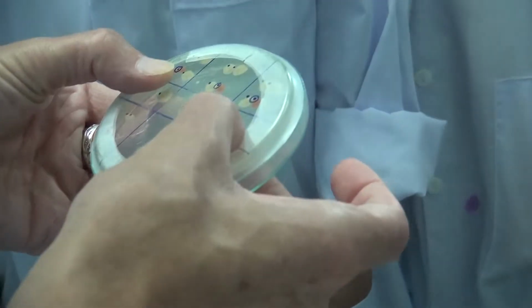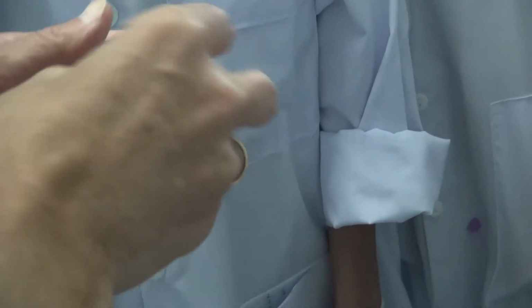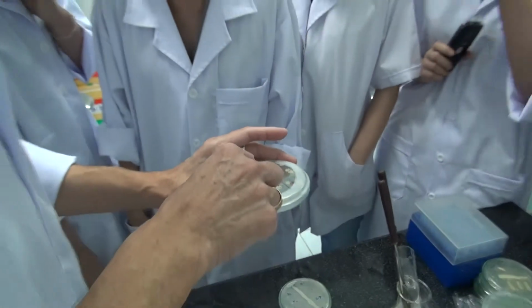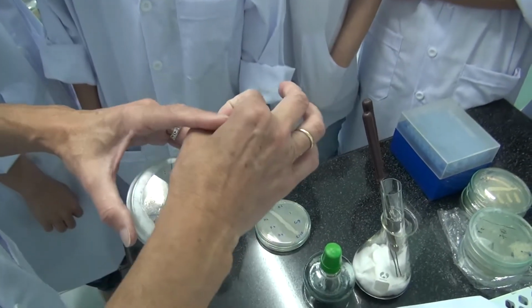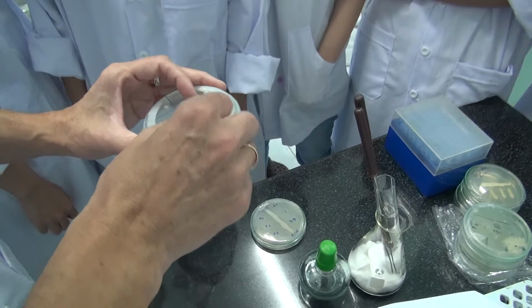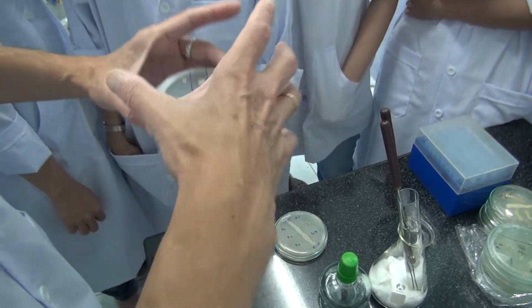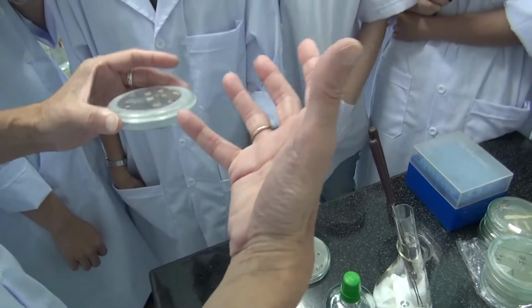What I want to point out is, by using plates, just like your colleague did with the fungi, you can find a lot of different types of interactions. So if you had, for instance, here one colony, if it's growing alone, it has a certain size, and if near it there's another colony and it's growing faster and bigger, then you can think that they may be exchanging something that makes them grow better.